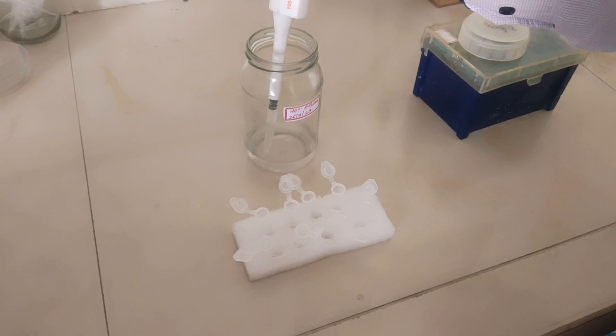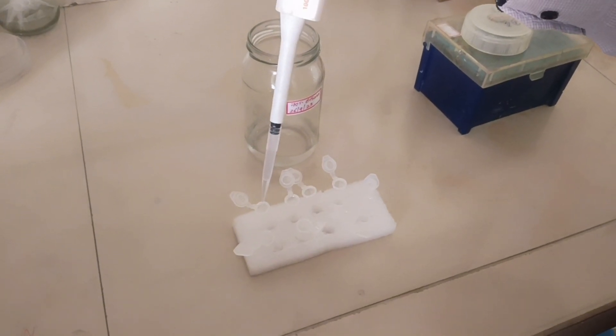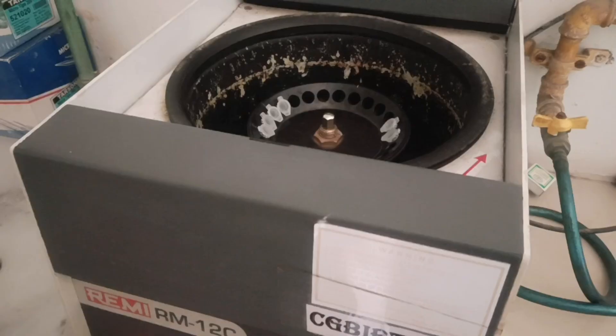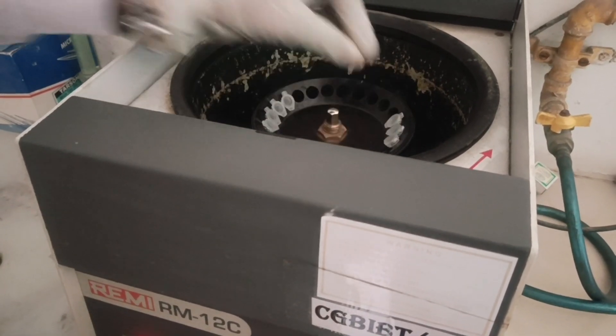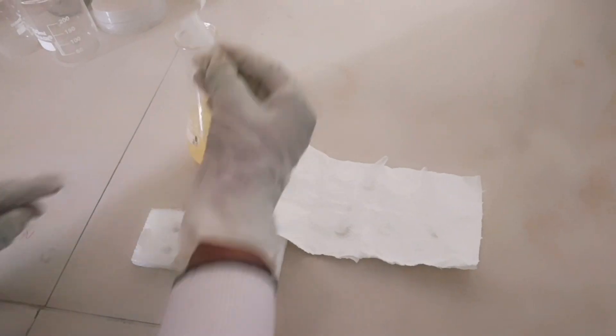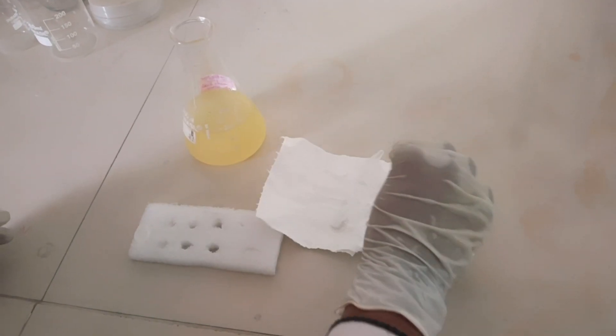Add 200 microliters of 70% ice-cold ethanol in each tube. Centrifuge all the tubes for 1 minute at 5,000 rpm. Decant the supernatant and let the ethanol evaporate.